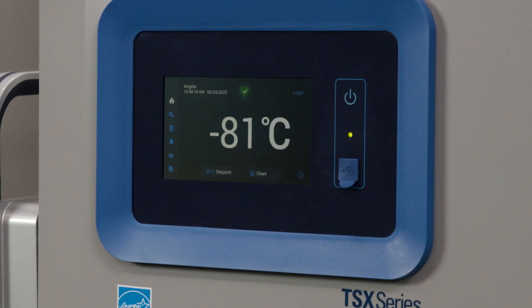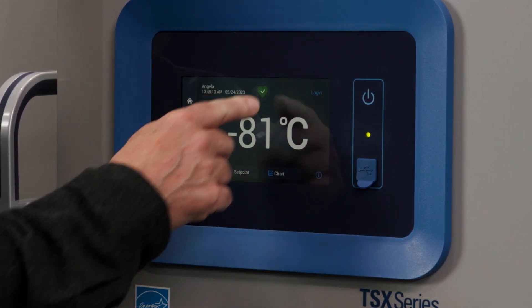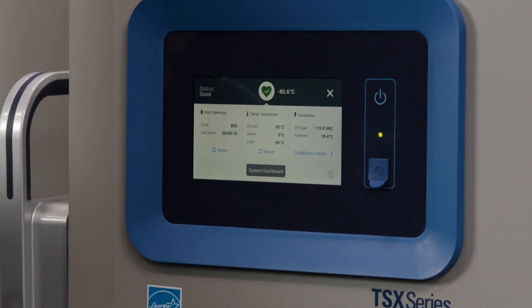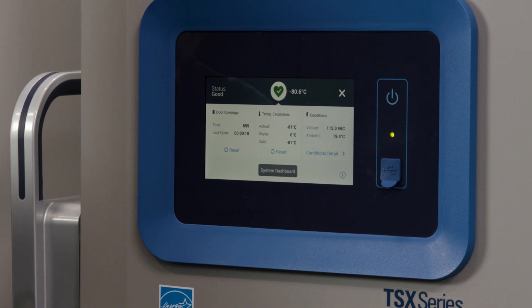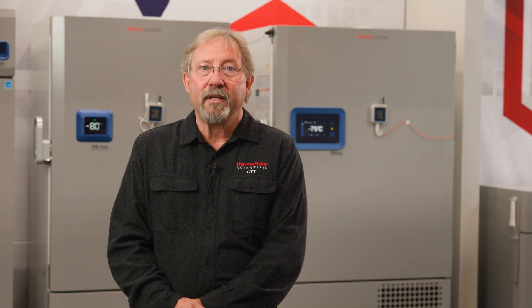In this video, we'll talk about alarm limits: what they are, how to choose them, and how they can benefit you. Alarm limits are usually chosen via a risk-based process that helps you always store your samples within a predetermined temperature range. There are many rationales for determining this range or limit, and you'll have to decide what parameters best meet your needs.